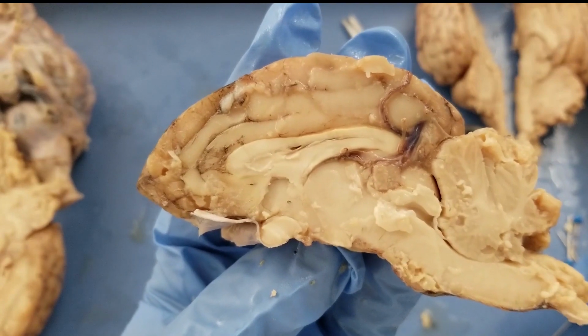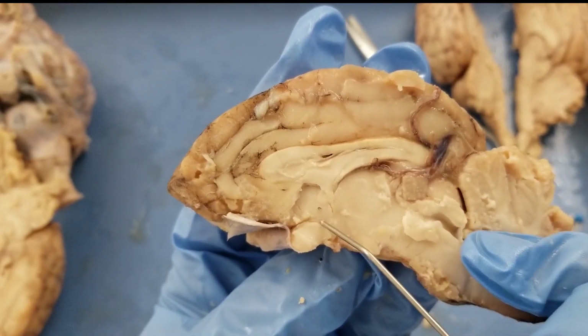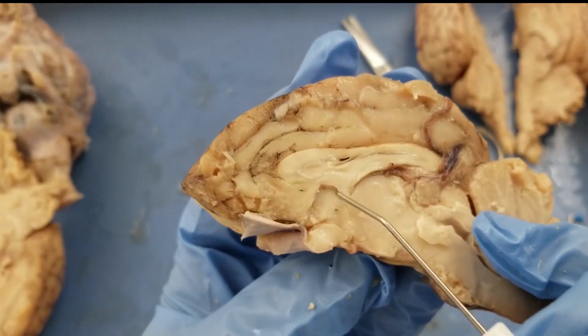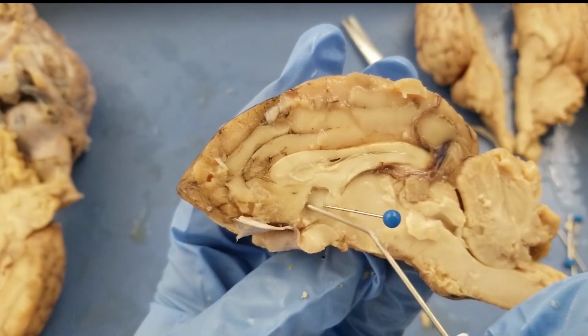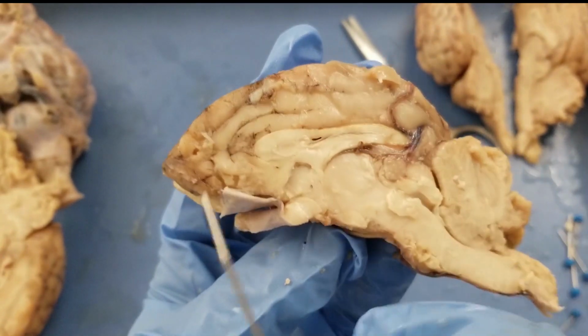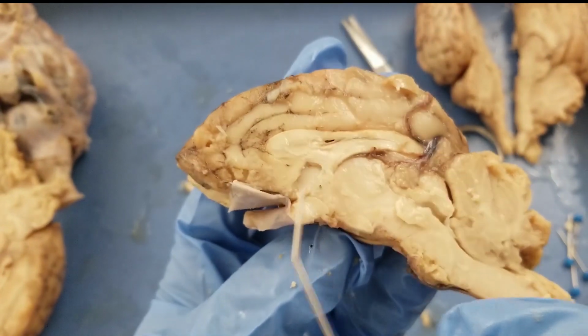So next one is the anterior commissure. The anterior commissure is somewhere in here. It's above the optic chiasm. It's not distinct, but roughly we can tell the region. So, anterior commissure. Commissure means crossing, so this structure is also connecting the left and right brains.